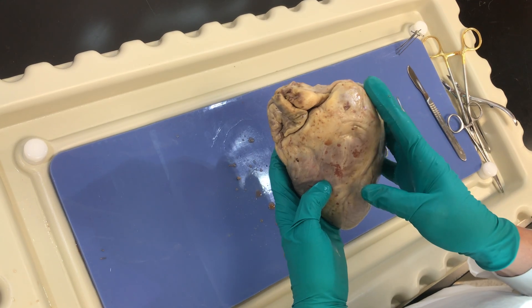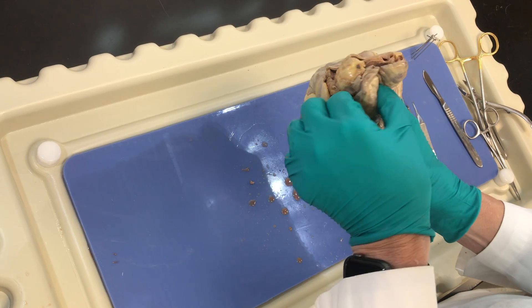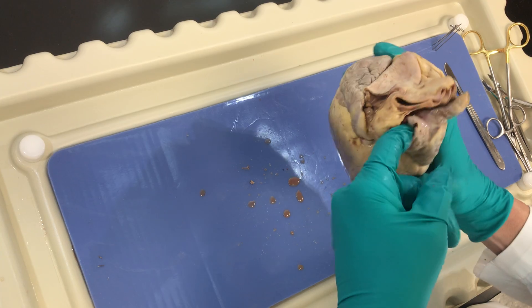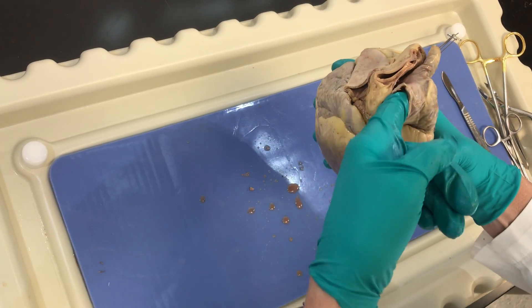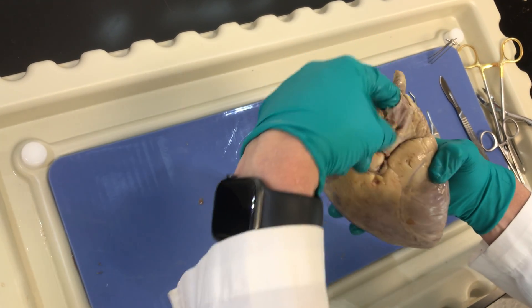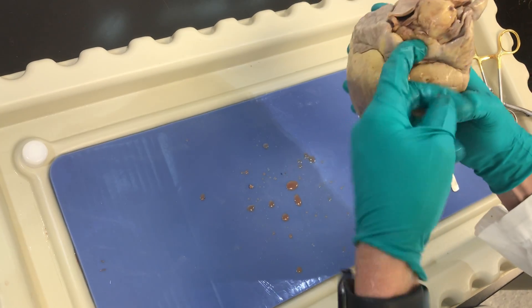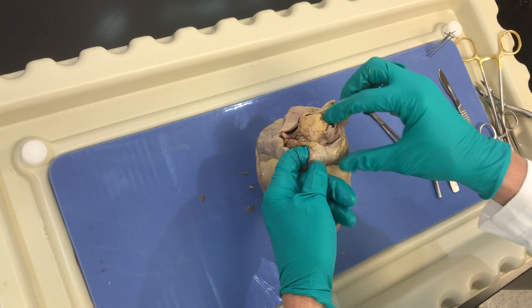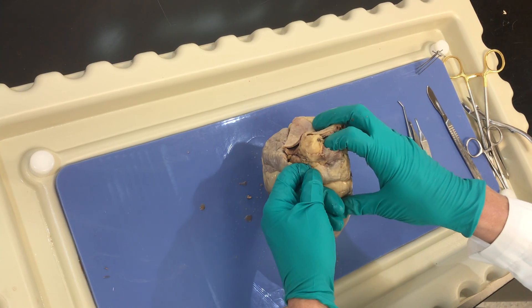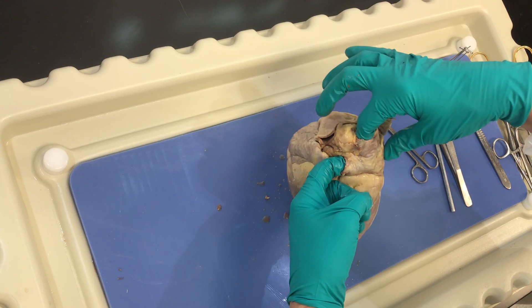If I do a 90-degree turn to look at the structures that are entering into the right atrium, I'm going to look at the right auricle and lift it up. There are going to be some entry points here. This is going to be my superior vena cava, emptying into this space right here — you can stick your finger in and see that. Additionally, I'm going to have another opening right here, which is going to be my inferior vena cava. These are bringing blood from the superior portion of the body and the inferior portion — the lower limbs — emptying into the right atrium.